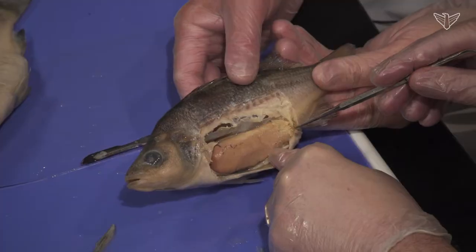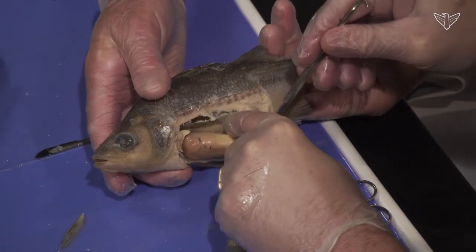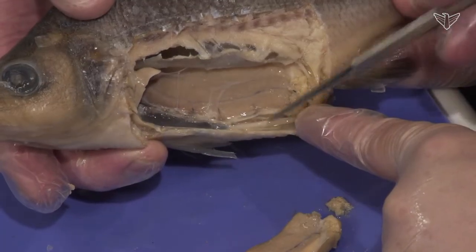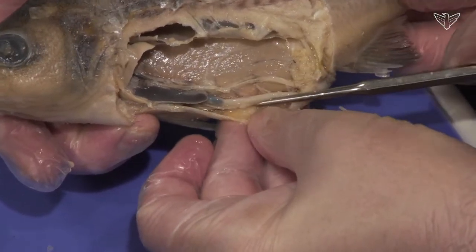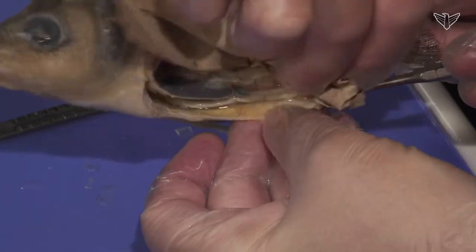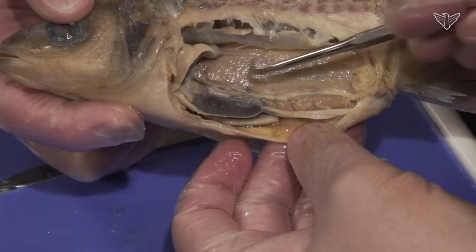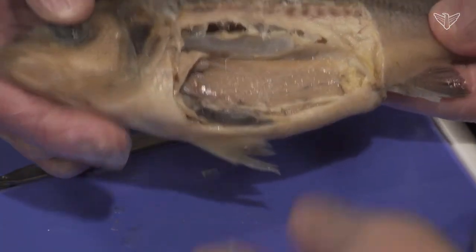In this case I'd go ahead and try to remove that ovary — and it's huge. The whole digestive tract has just gotten squished down to the bottom. If your students are looking at a female like this, it's going to be a little hard to see because there's the intestine going down to the cloaca. Here's the spleen — this gray structure. Everything's gotten really compressed because of the amount of energy and resources they put into reproduction, so we'll have to cut up into there a little bit to see some of those things that got pushed back.